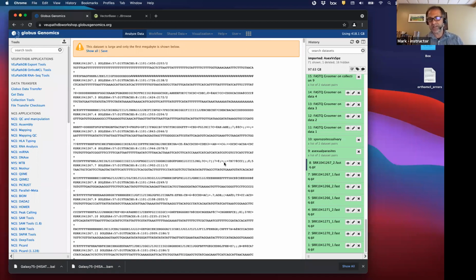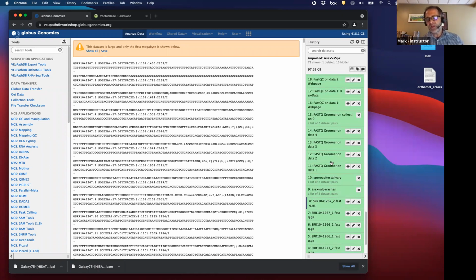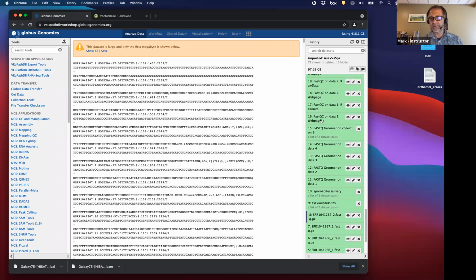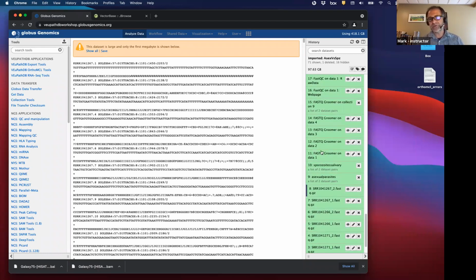Okay, so FastQ files, and then what we did is we paired them up into the appropriate pairs. And you remember there was a left pair or forward and a reverse, and there were replicates. And so we did list of data set pairs. And then the first steps are really about making sure that these FastQ files have high quality reads. That's what these different steps are doing, making sure the FastQs are formatted correctly and are high quality. So the FastQ groomer was one tool we used, and it makes sure that there's no spaces. It makes sure that the encoding is as you expect, etc. Okay, and that's a nice step.